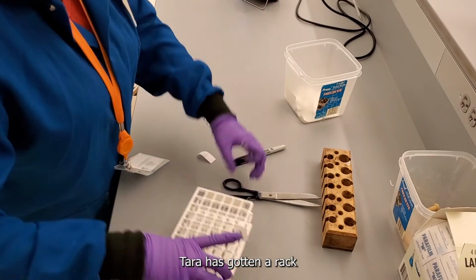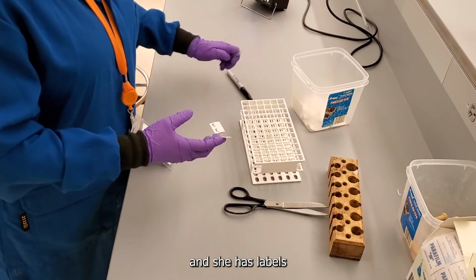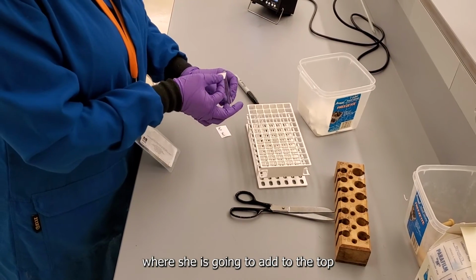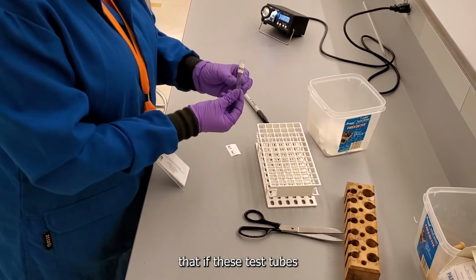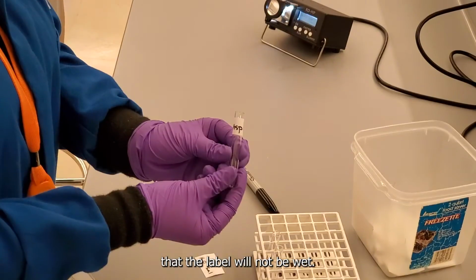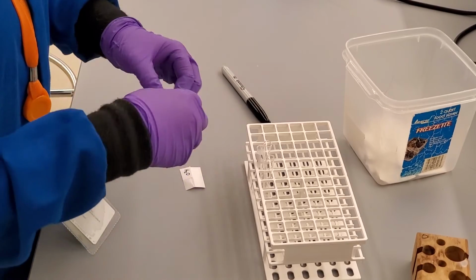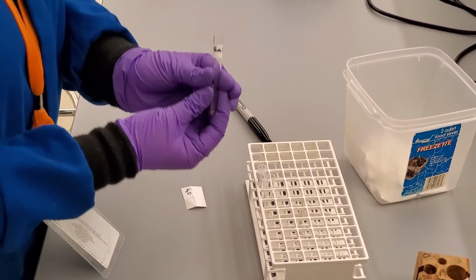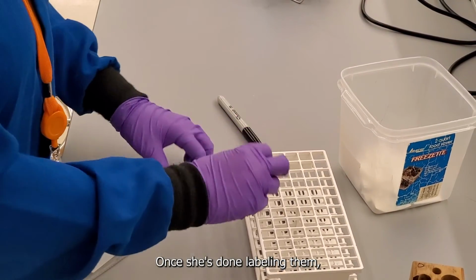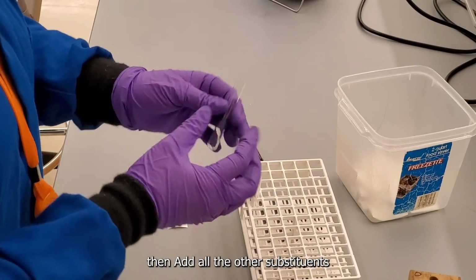Here you can see Tara has gotten a rack with all of her test tubes, and she has labels which she is going to add to the top of the test tube. That is to ensure that if these test tubes need to be heated later, the label will not be wet. Once she's done labeling them, she will move to the hood where she will then add all the other substituents to the tube.